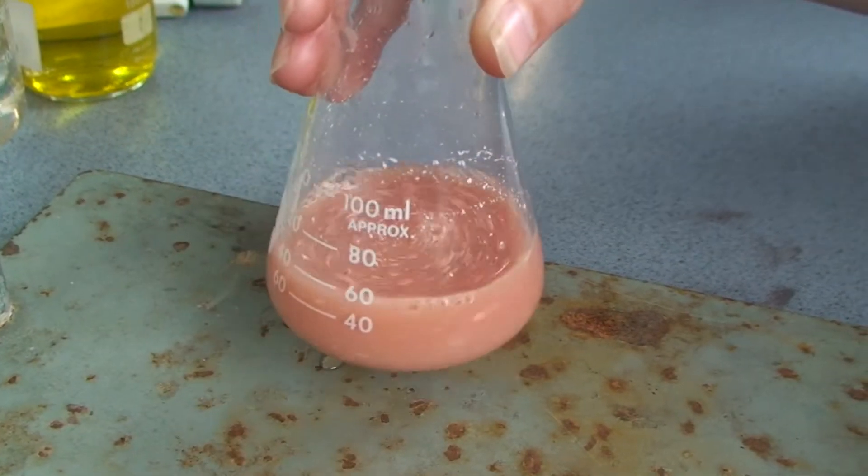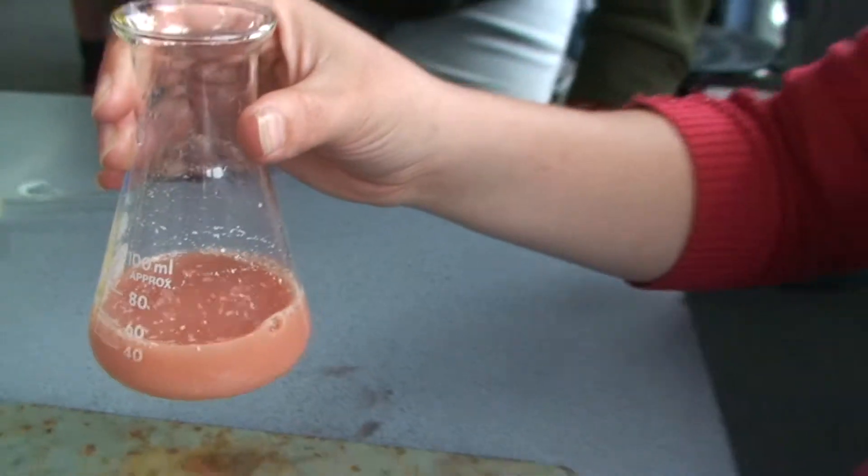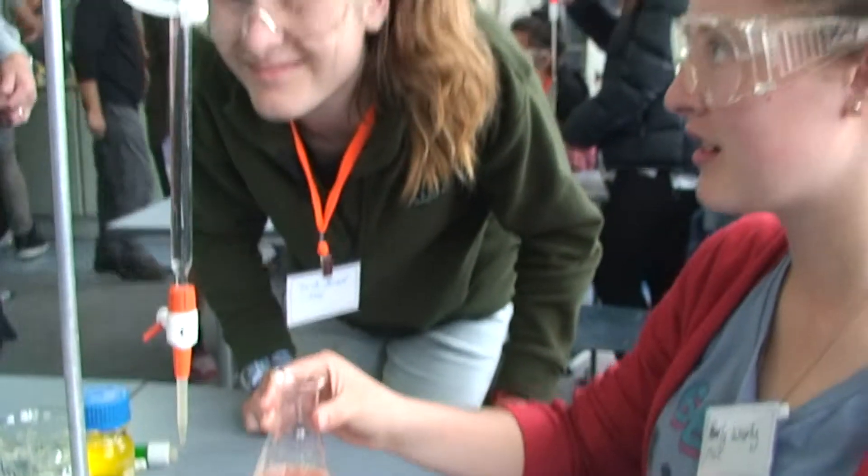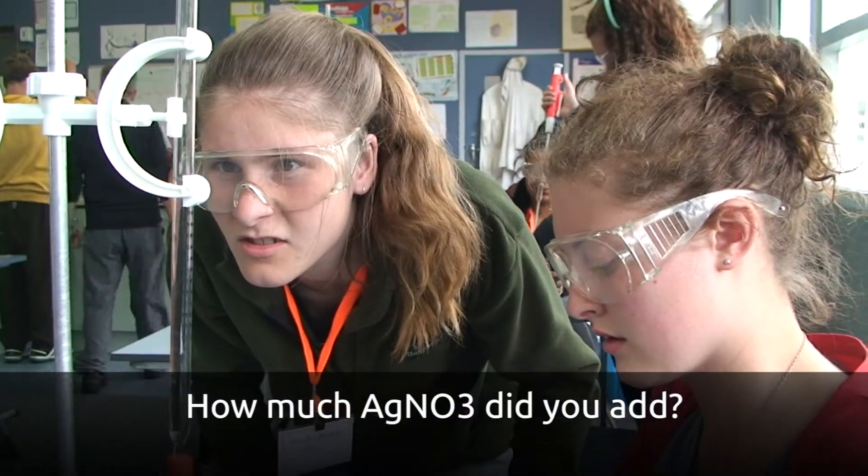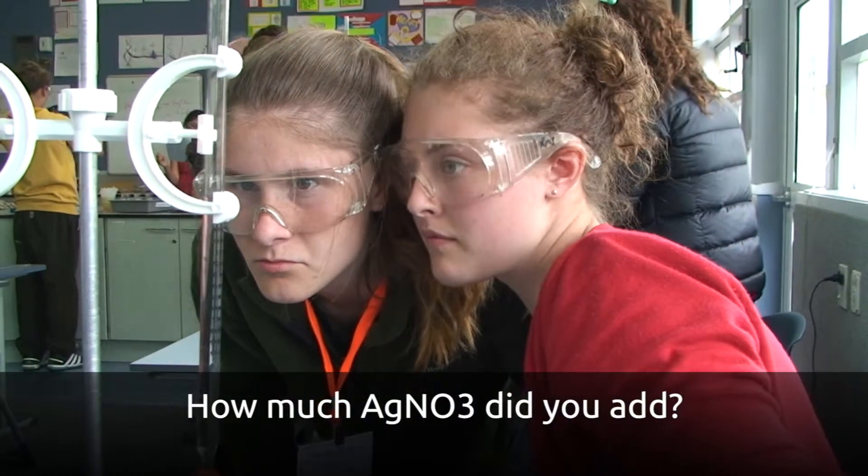So it's now orange, staying orange, it's not going away. And that tells me that all the chloride has reacted. And then, I can then record the volume of silver nitrate.